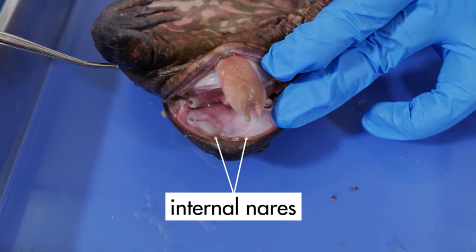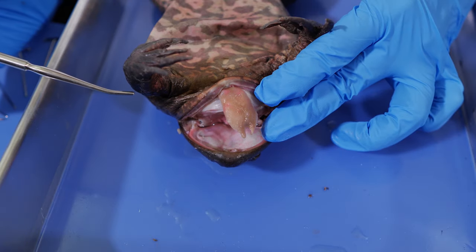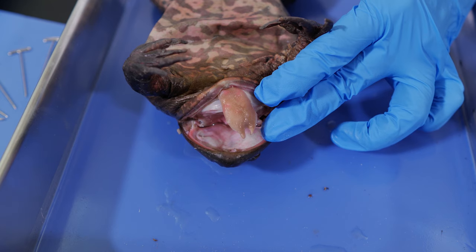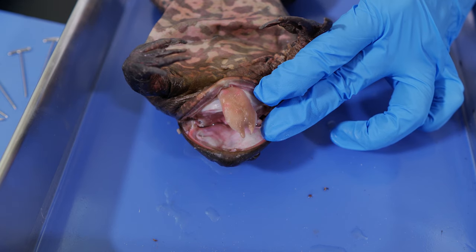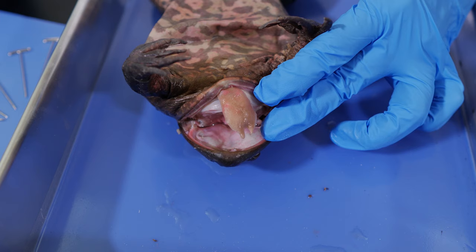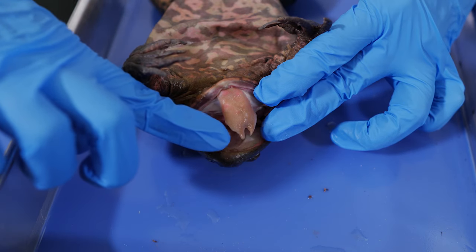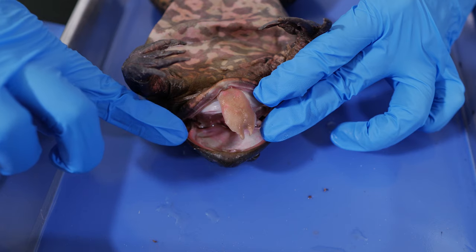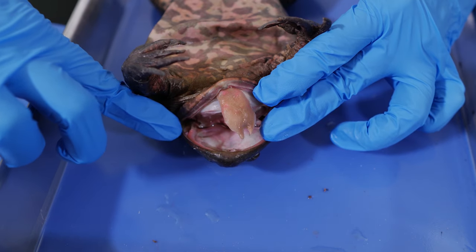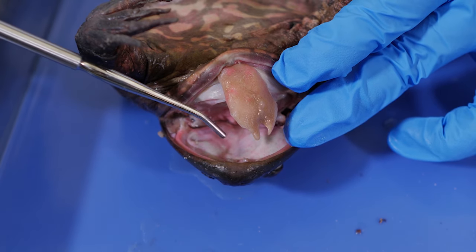Did you know that some frogs have teeth? A frog's teeth are not made for biting or chewing like our teeth are — they are designed to hold the frog's prey while it eats. The bullfrog has a row of tiny teeth along the edge of its upper jaw, and right between the internal nares is another set of teeth.